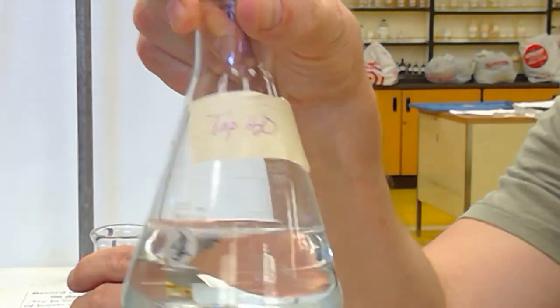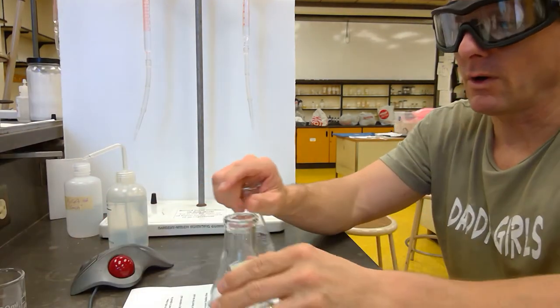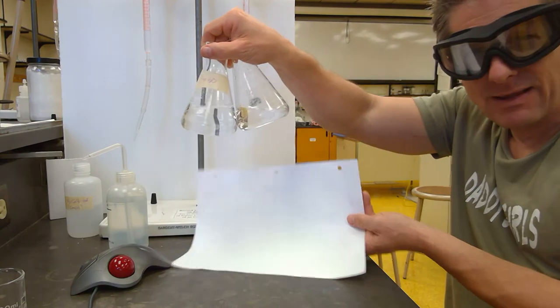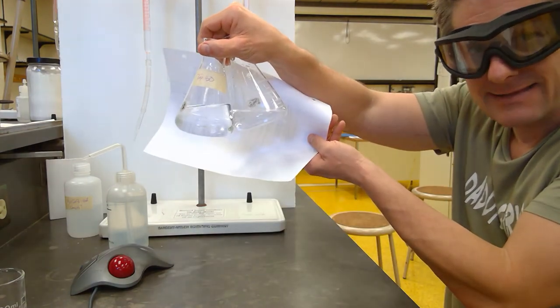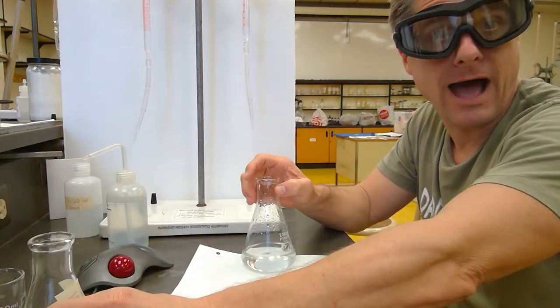I need to have a colorless reference. I like to have tap water with me. I like to have a colorless reference where I'll hold the two up together and then put a white background where I can't see the pink color. And I can't see it there, so that's not enough. Make sure you don't start titrating your tap water.